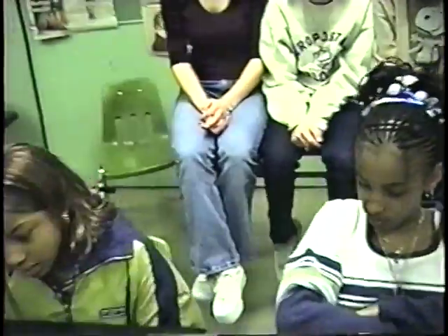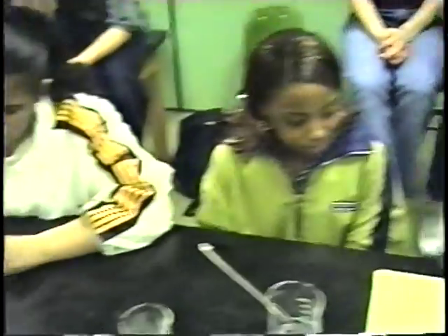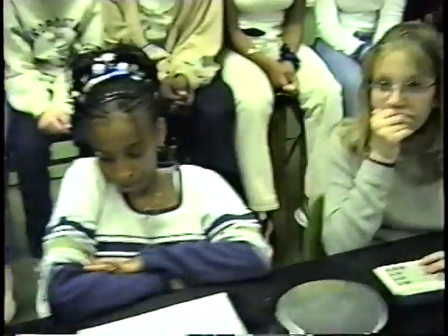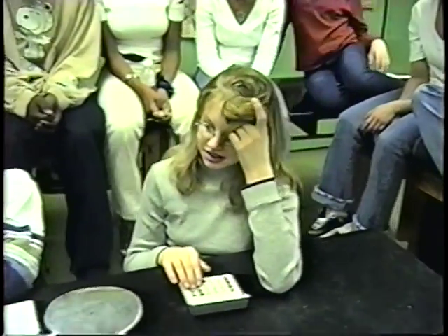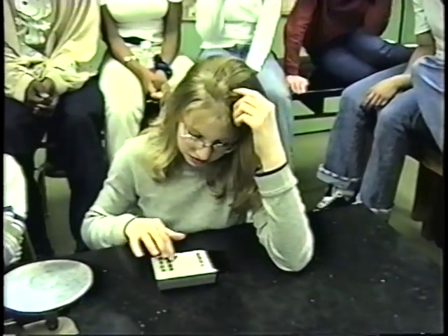Now, she's waiting for the temperature to get to something called TF. What does TF stand for? Final temperature. Okay, so what'd you get to? 32. If you would write down 32, and plug in the 32, and tell us the Kelvin equivalent of 32. 305. And if you could write down 305.